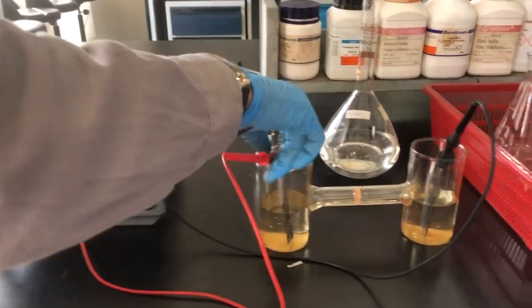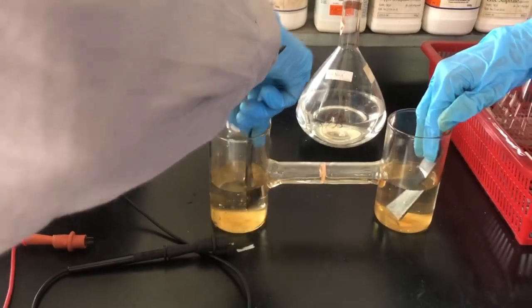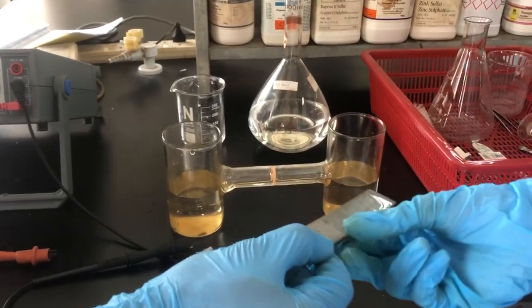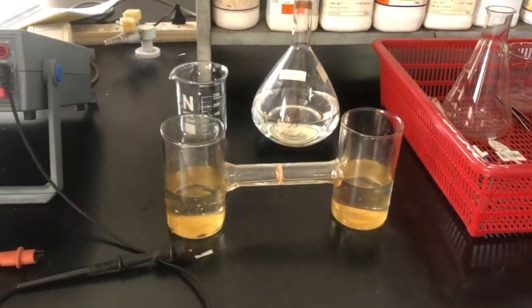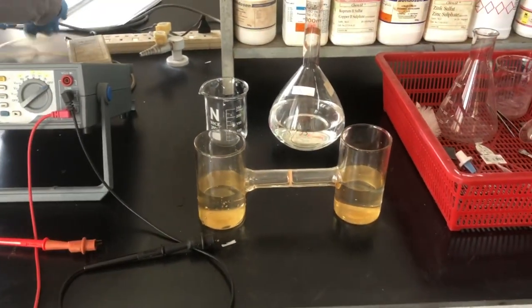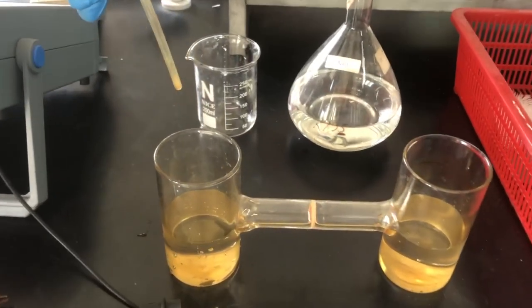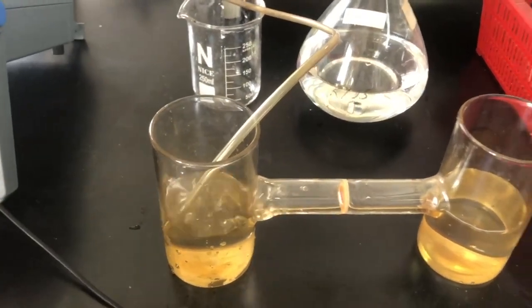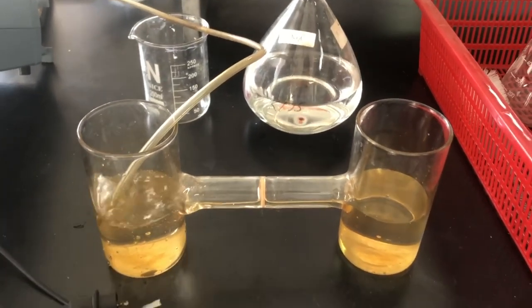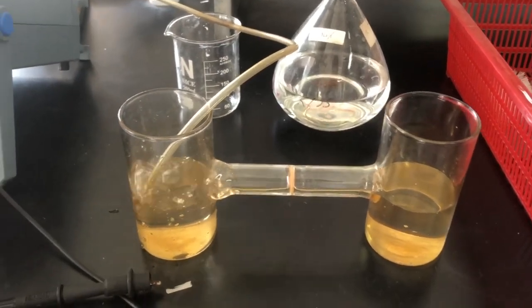We unclip the cables and remove the plates for re-polishing, as each plate needs to be polished fresh. Meanwhile, we place the oxygen pump inside one compartment and bubble it for a few seconds or minutes. The longer you bubble the oxygen, the better the result.